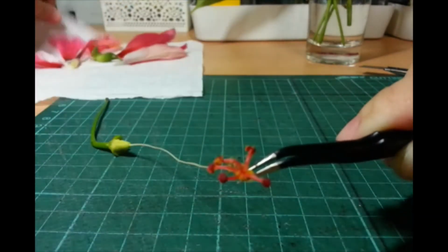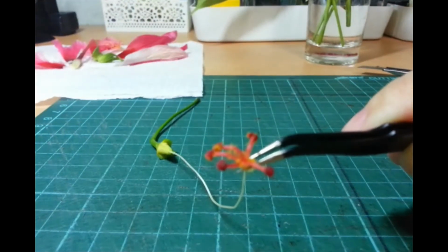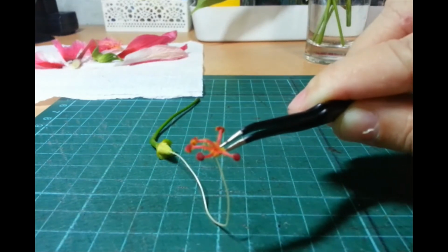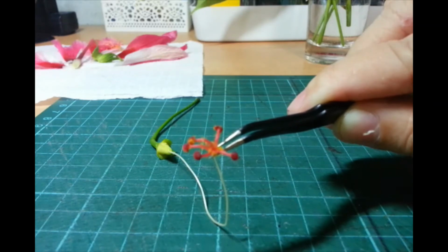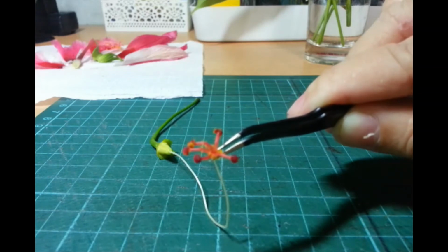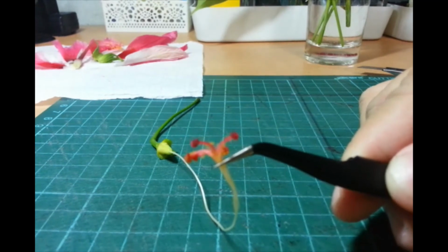Let's see. Sorry, ang kulit. Ang kulit ng pag-focus. Okay, yan. I guess that's the best we can do. That big red roundish surface there, that's the stigma. Okay, side view. Medyo flat.